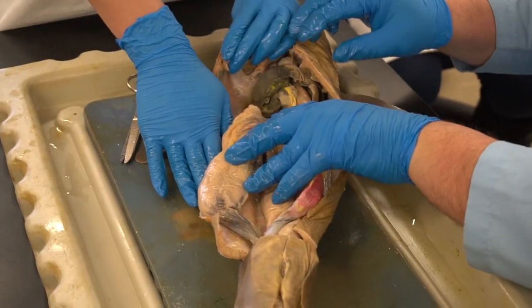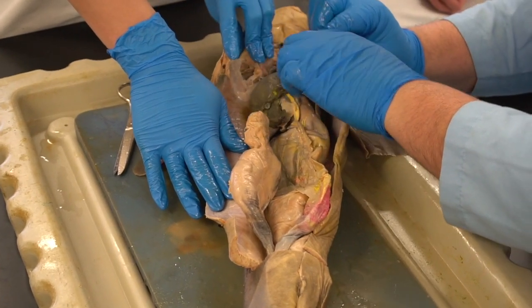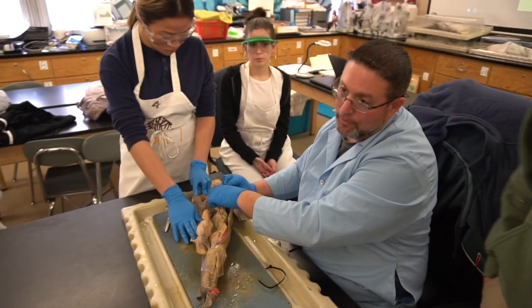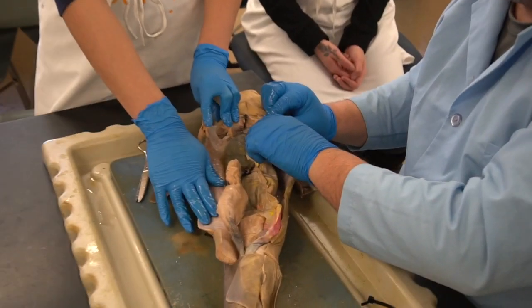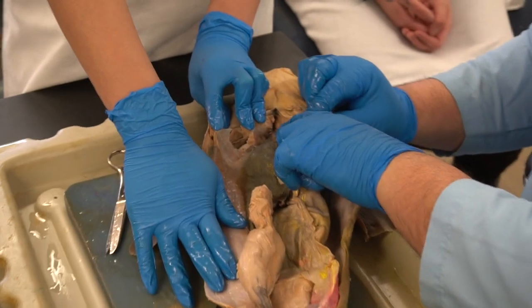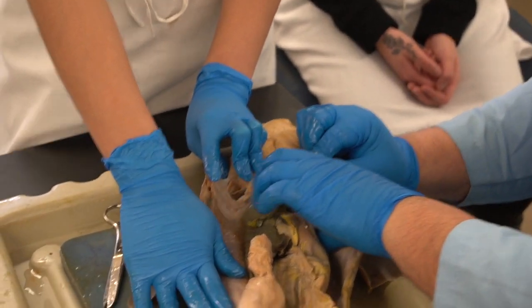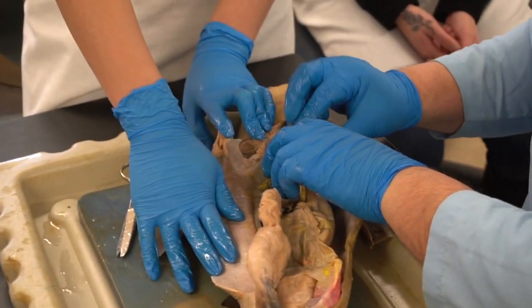All right, so let's start from the anterior part of the cavity. The upper part of the cavity here is the pericardial cavity. Peri is the prefix meaning around. Cardial, heart. So that's the cavity we enter. You can see it's a multi-chambered heart. There is a much harder ventricle, whose job is to pump blood throughout the body, and a softer auricle, which allows blood to come back to the heart. So you have a multi-chambered heart.